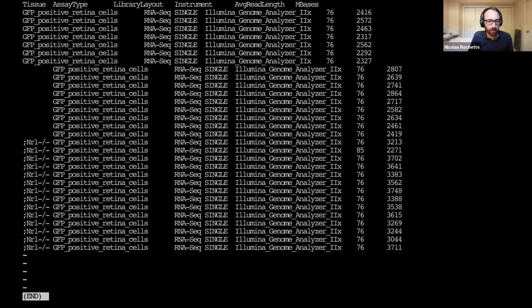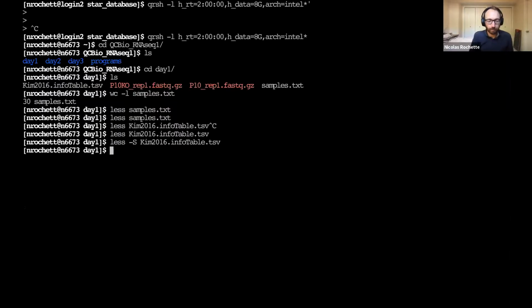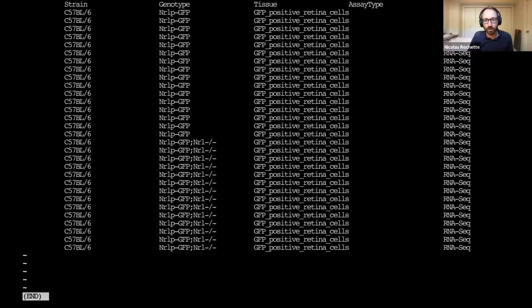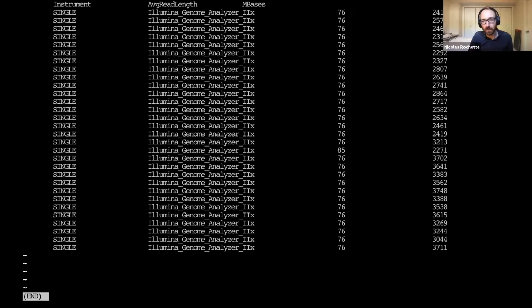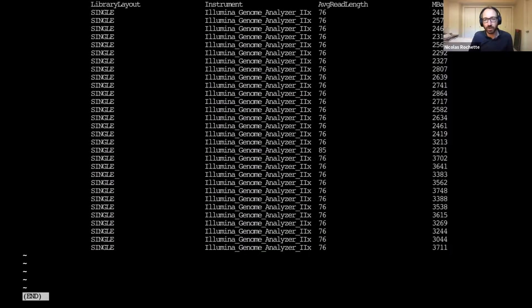But still, all the fields are shifted. The columns are not displaying properly. And so what we can do with less is also use the S option, and we can use longer tabs to just make the columns wider. And this lets us look at this file in a cleaner way. And here, actually, there is still an issue. I'm missing one character, and then here as well. So I'm just going to increase it a little bit more. And now the columns are not shifted anymore.